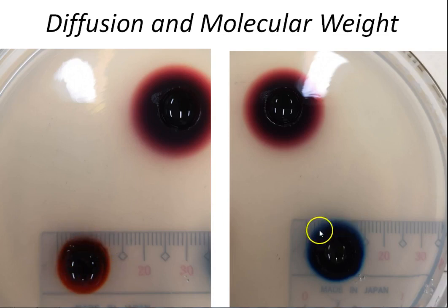Then here in the other hole, we have our 1% methylene blue. We place 0 on this side, and on the other side, this is the edge of our diffusion. What is the number? What is the measurement that we got from this experiment?